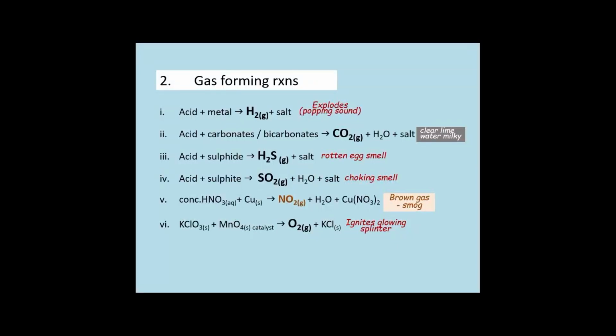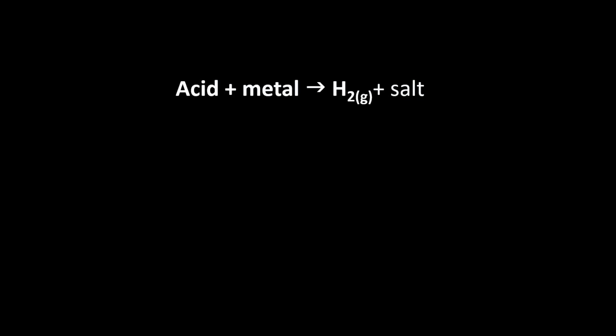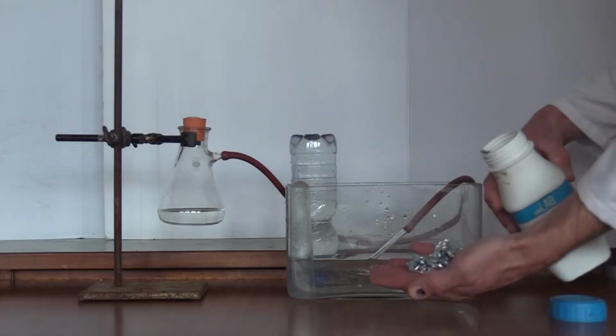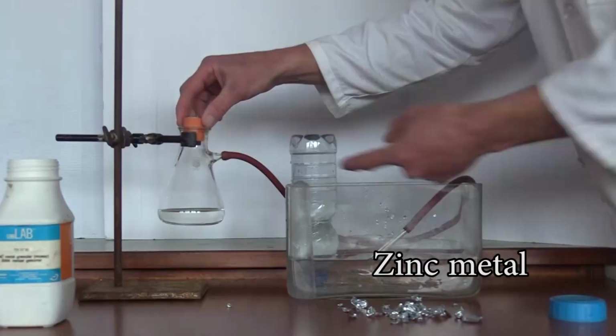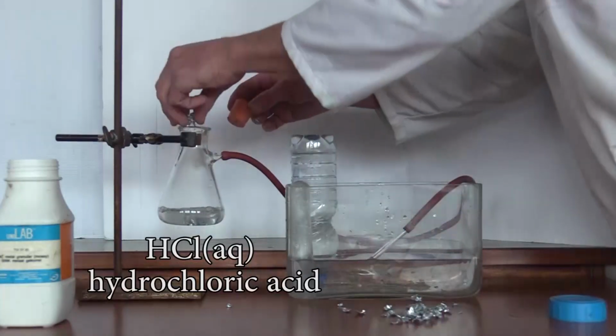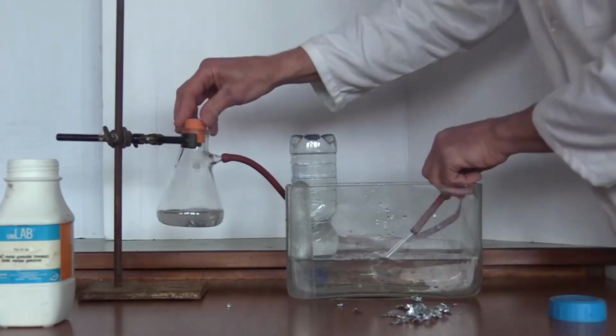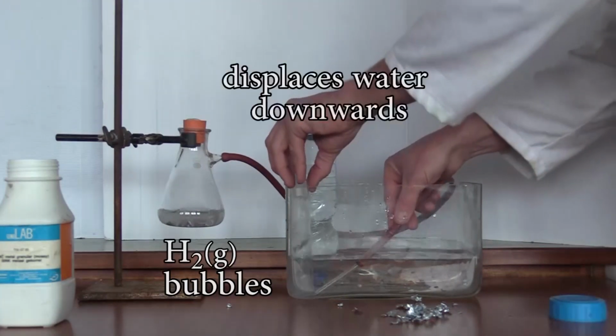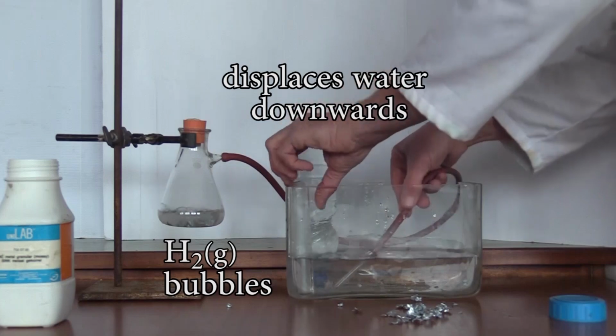Gas forming reactions. The first of six is when an acid and a metal react to form hydrogen gas and a salt. Let's add some zinc to some hydrochloric acid. We stopper it and we see bubbles of hydrogen gas coming out. We collect it by displacing the water downwards.